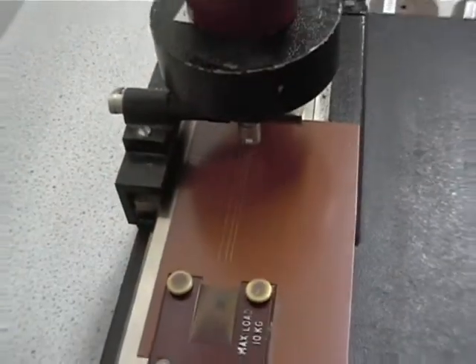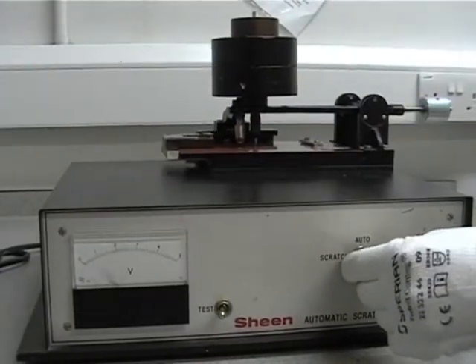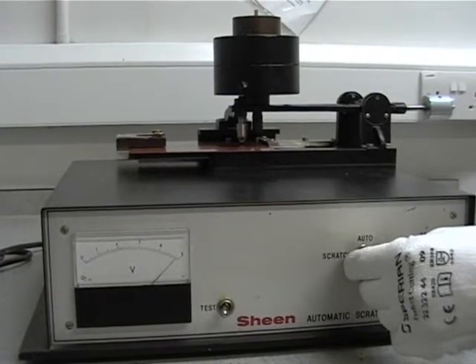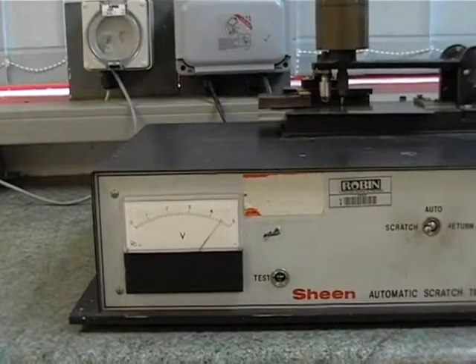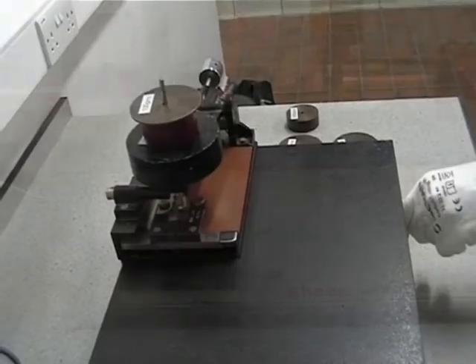Although the scratches are all visible, the equipment tests when the needle penetrates right through the paint layer to the metal substrate. A voltmeter confirms when contact is made between the needle and the substrate.